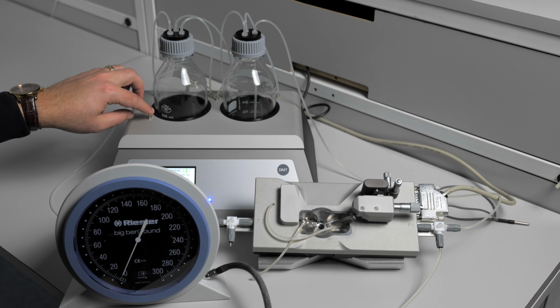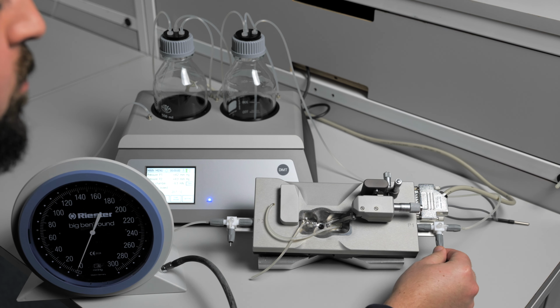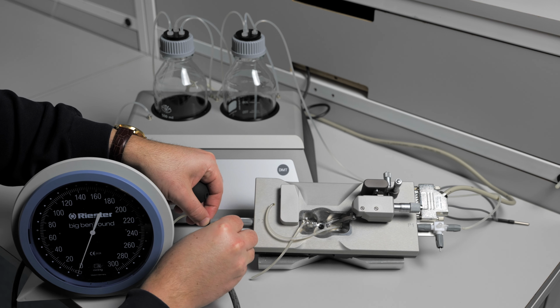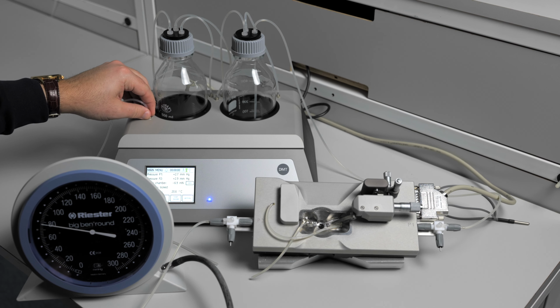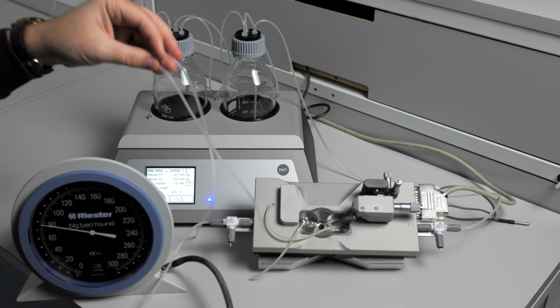You can replace the tubing or you can check the P2 three-way valve. Connect your Big Ben manometer to the P2 three-way valve and close the valve. Add pressure and you see that it is holding very steady. That means you have a leak in your tubing between the interface and your P2 three-way valve. Replace this tubing.